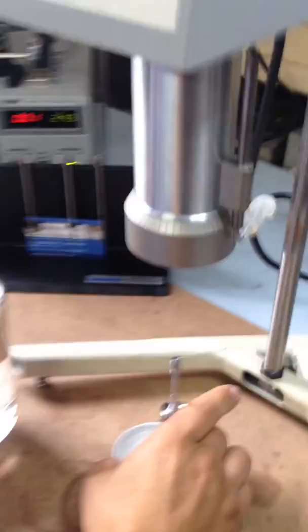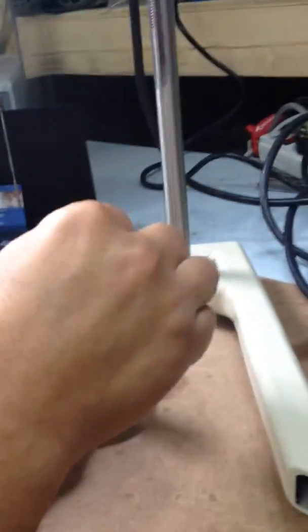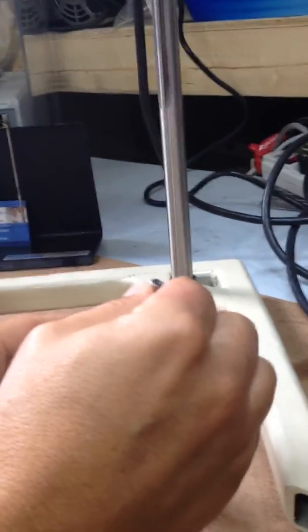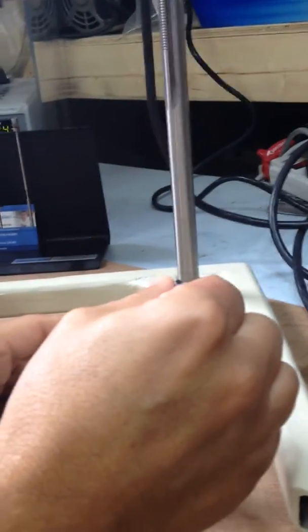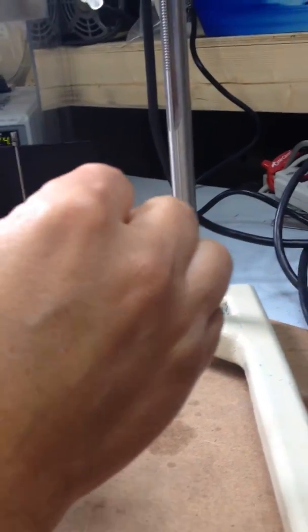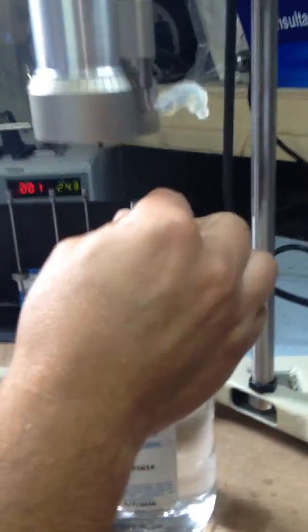We have your viscosity and you have your spindle. We'll take spindle number one because your product has a very low viscosity, it takes a big spindle. We put it in like that.